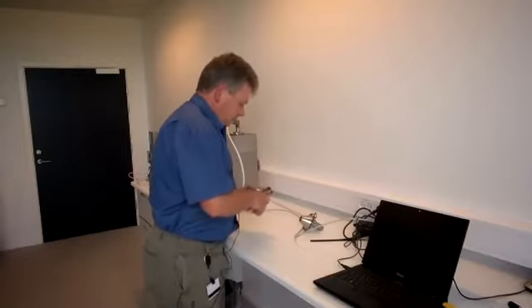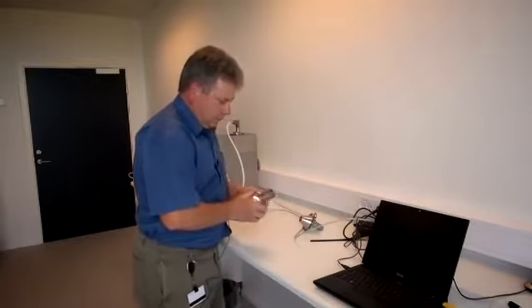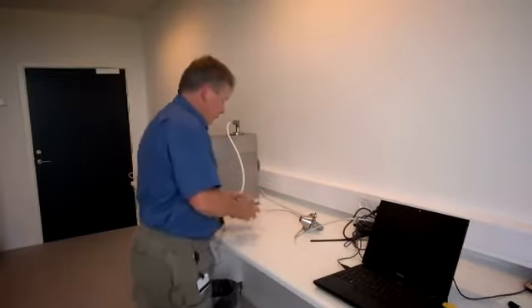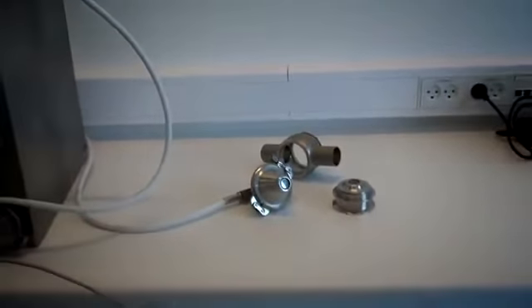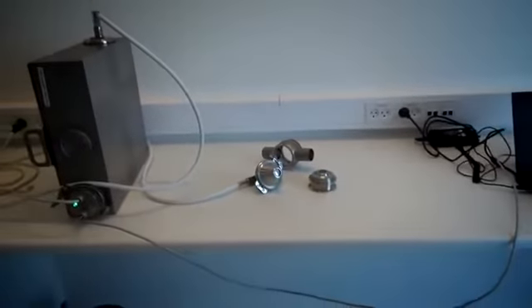So what we normally say is, what is the critical parameter in this step of the process? And this is used for process optimization. The other ones we will call monitoring. They may be monitoring something going on further upstream in the process. You can take any application or any installation of inline. The most important thing is, as I said before, you have to find the critical point in your process and find out what parameter is important to control to optimize your process. I can take an example from dairy, from the flour mill, or you can go to a meat plant. It is the same story all over.